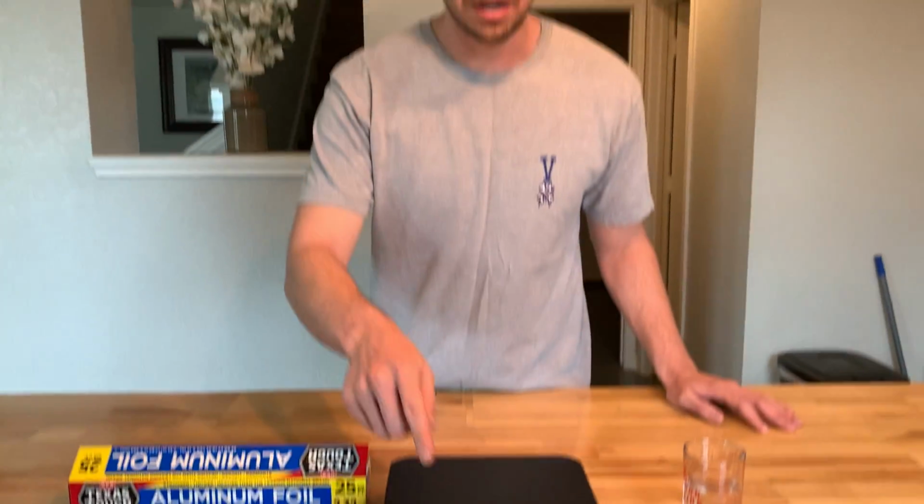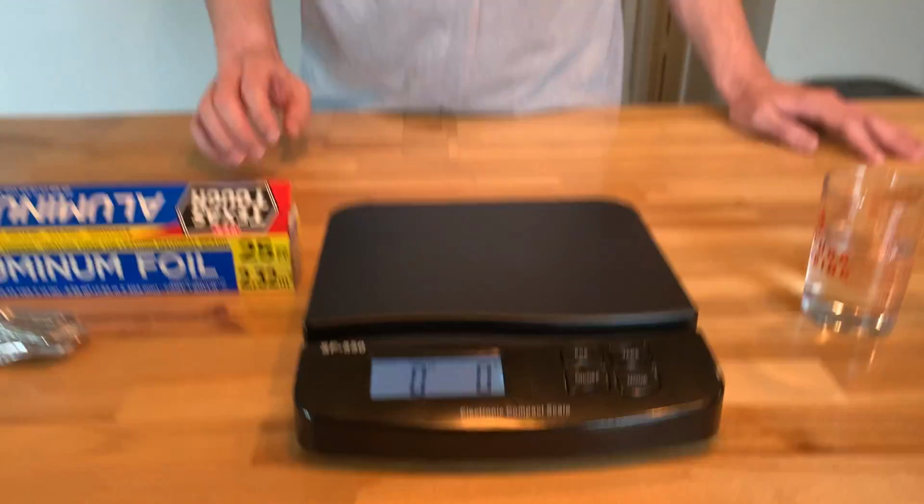So in this lab episode, we're going to be talking about density. Density is mass over volume, and mass is something I can calculate easily because I have an electronic scale, which I have set in grams. And also volume. Well, certain things are difficult to measure with volume. See, something that is irregular doesn't have dimensions where you can just use a ruler and calculate the size.